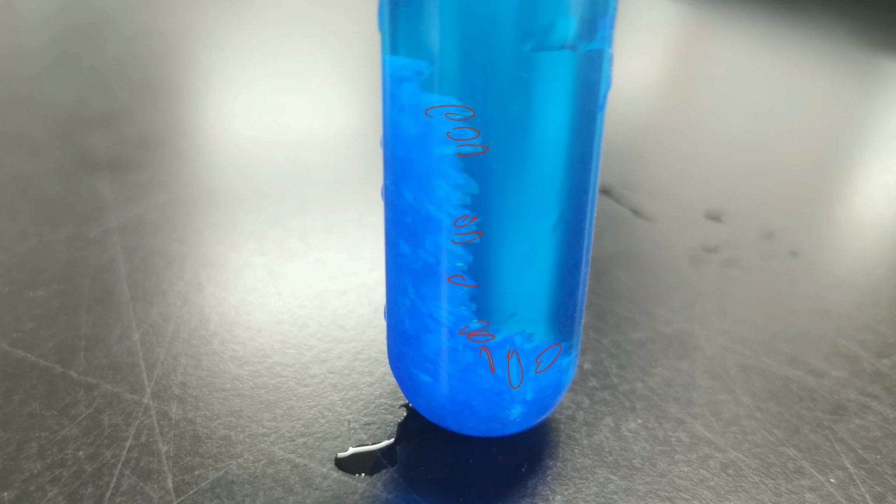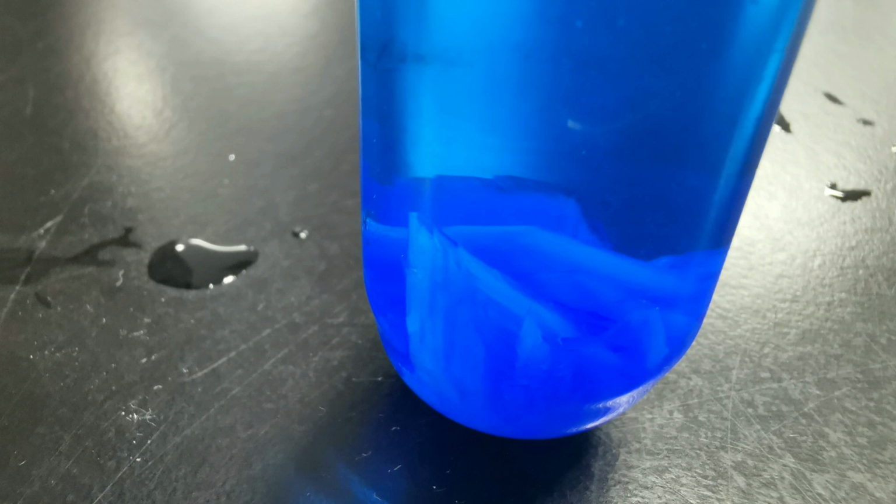So now the middle test tube, which was just sitting in a beaker, it wasn't insulated, but it wasn't cooled down particularly quickly either. Crystals definitely larger than what we just saw. So in the ice bath, really small crystals. Without the ice bath, just normal cooling down, we have larger crystals. Now, if we take the one out of the cotton wool, if we have a look at that test tube, we see even larger crystals. I mean, look at the size of this guy. It's huge. There's another large one behind him, another large one at the back there. So we have really good sized crystals now, much larger.